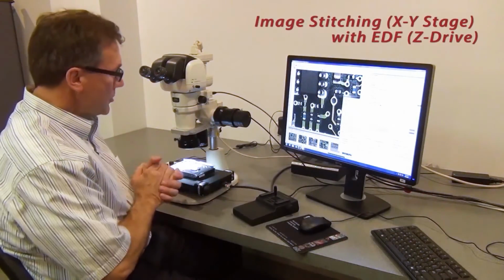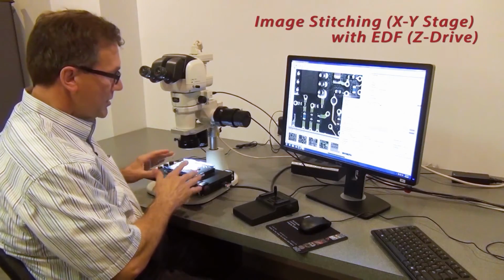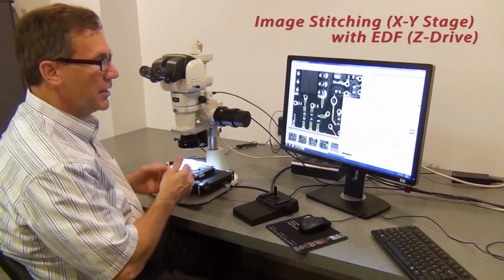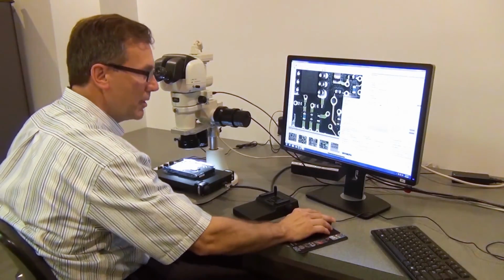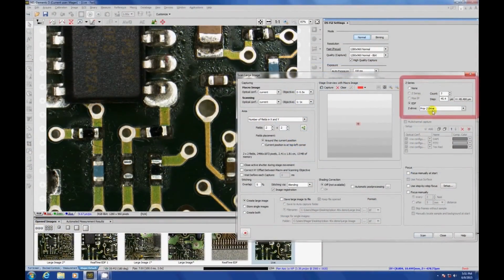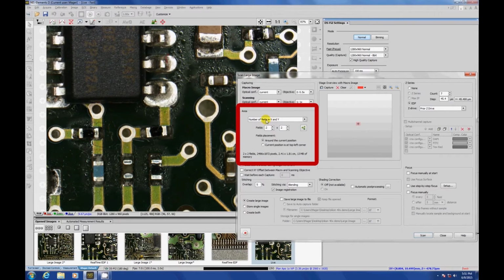So now we're going to put together the capabilities of the XY stage and the Z drive by doing image stitching and EDF together. So here we're into my Scan Large Image dialog box. Over on the right top side, I'm choosing to do an EDF as I do my image stitching, and I'm going to do 7 planes. Over here in the area, I'm going to do it a little bit differently. This time, instead of defining my top, bottom, left, and right, I'm just going to say do 2 by 2 around my current position. And I simply hit scan, and off we go.